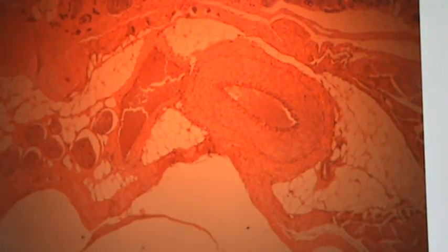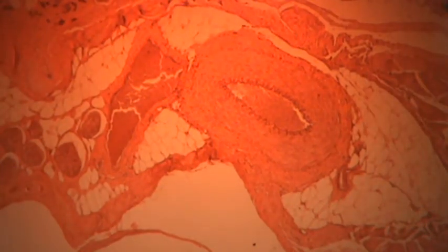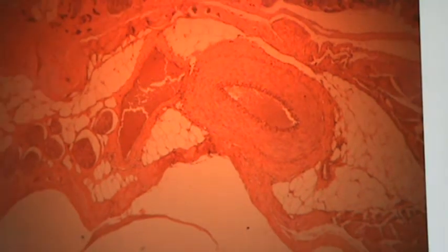Alright, and oh yeah, here, let me zoom again, just a little bit. There we go. And again, panning through, you can see this is just a cut section through, and you can see some of the adipose here, it's really common. And again, the reticular is off here on the edge, not reticular, but the areolar. And here we have the smooth muscle, and we got the blood, and we have the simple squamous again.